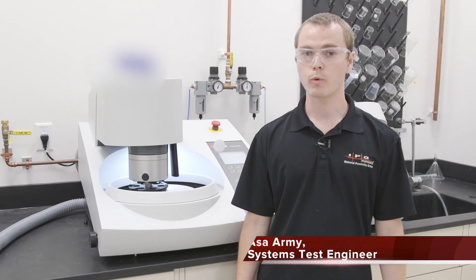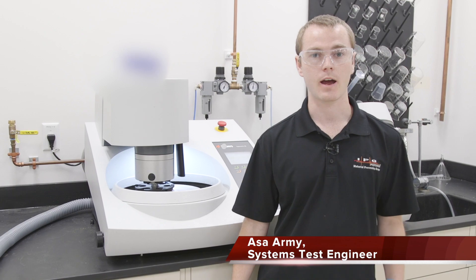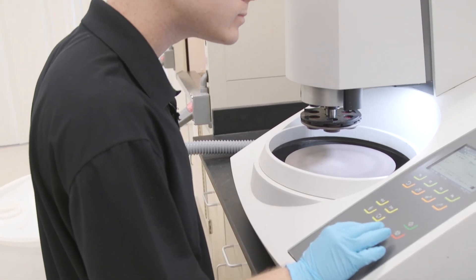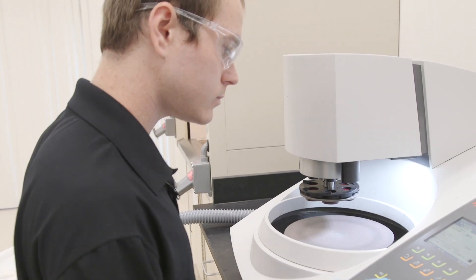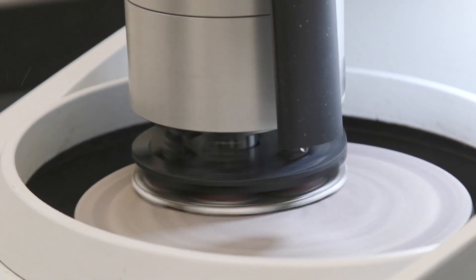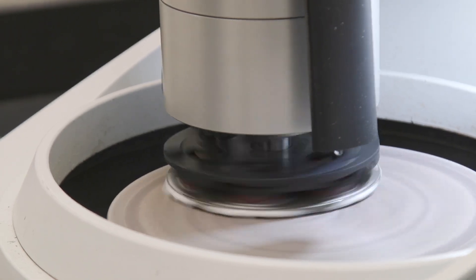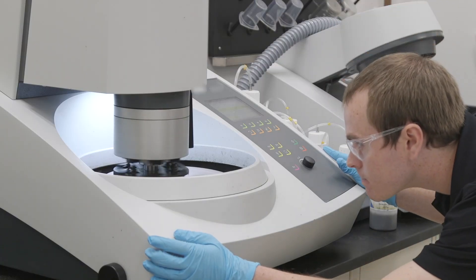This is one more step of sample preparation. After we dice the samples, we mount it in a hot press, grind it, polish it to a mirror finish, and then move on to etching where we drop acid onto the metal to bring out the grain structure and can actually see the weld bead.